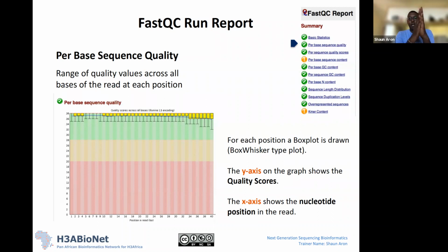It's plotted as a box and whisker plot, and I'll show you in the next slide what that is. For position 1, it's looked across all 250,000 reads and plotted the quality scores at position 1 for all of them. This is what it's showing you here on top. The yellow box is the distribution, and these are the whiskers.